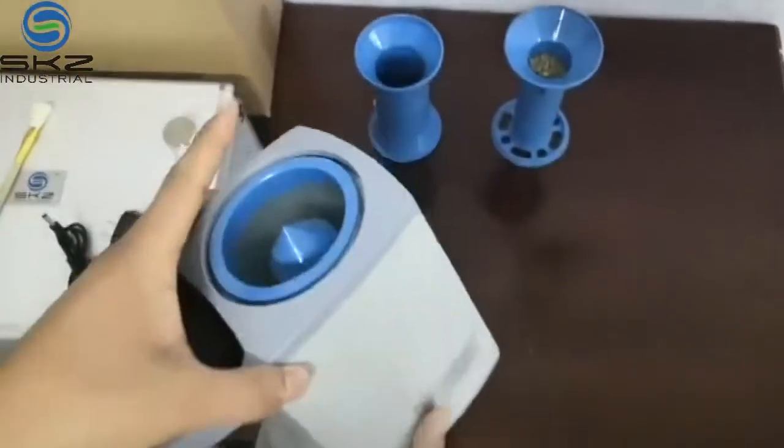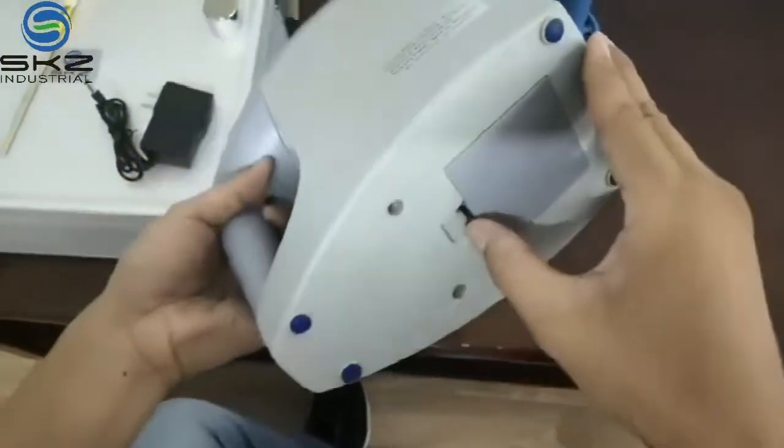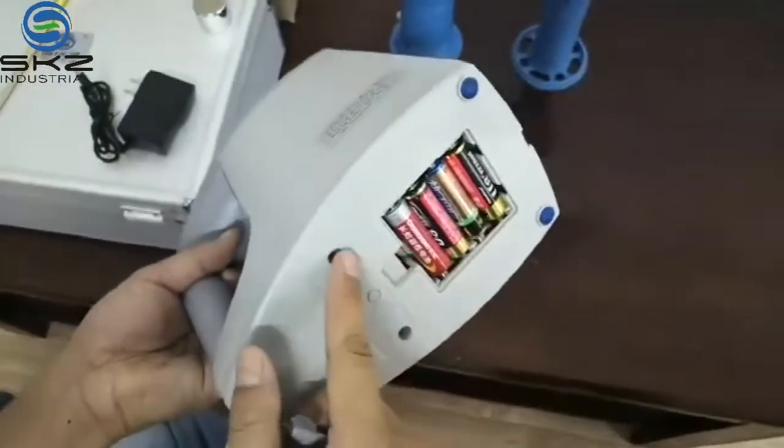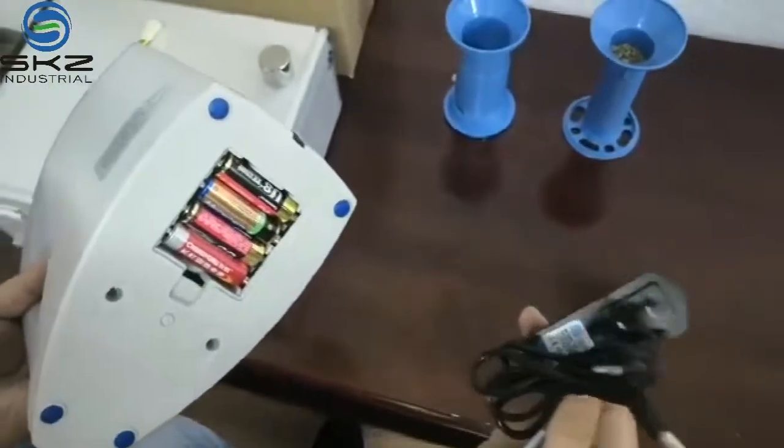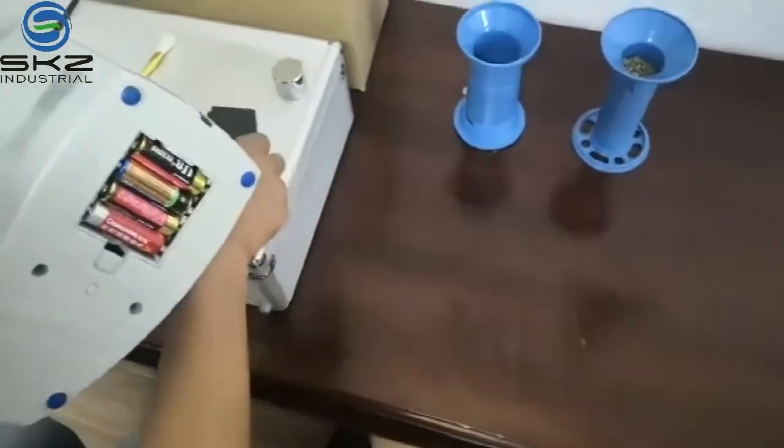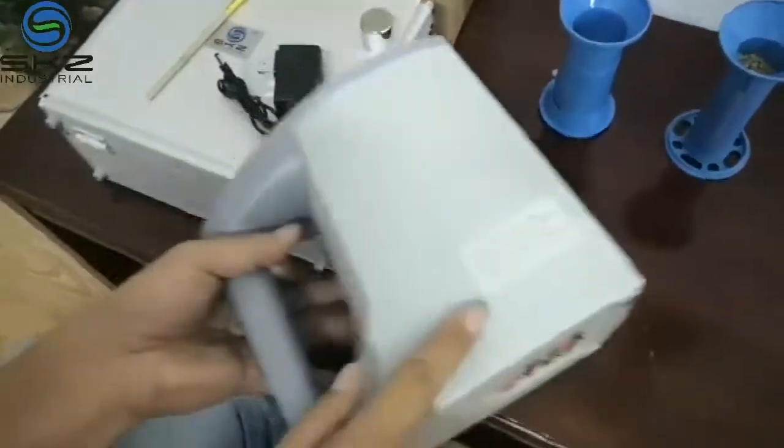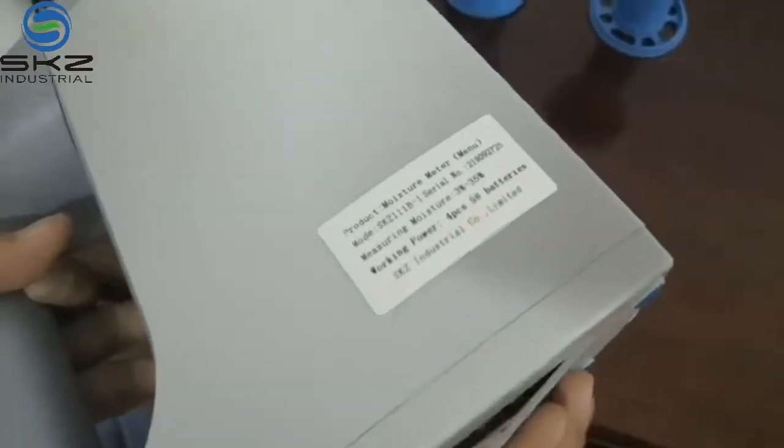First let's see. This meter can use two types of power: one with battery, another with the AC cable. Here is the name card.